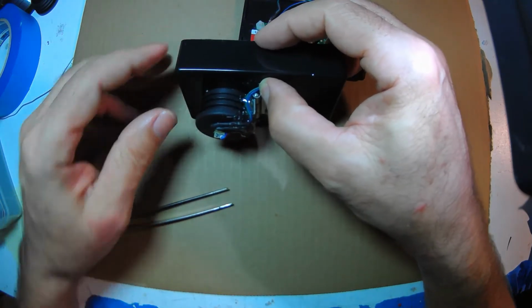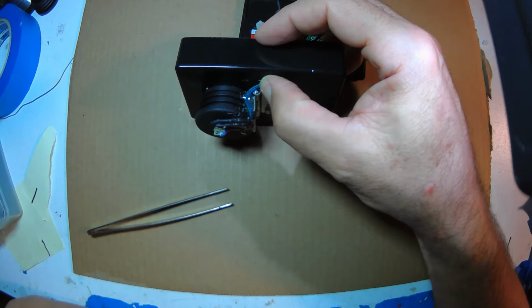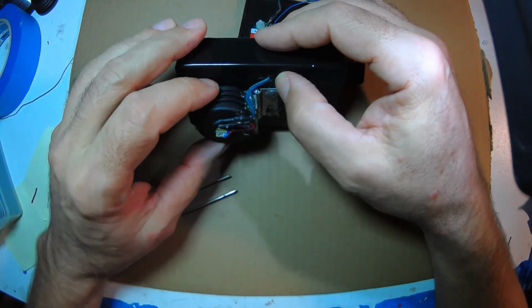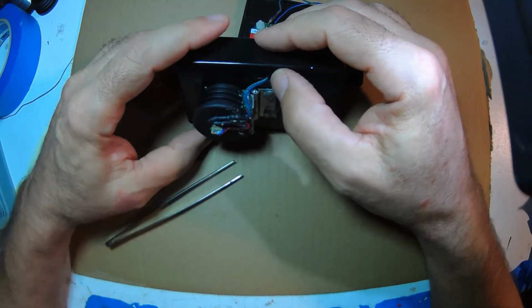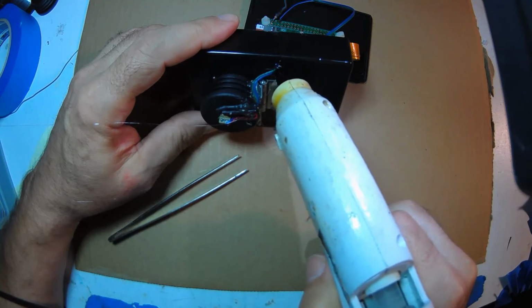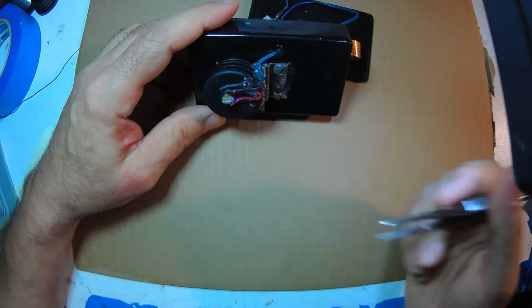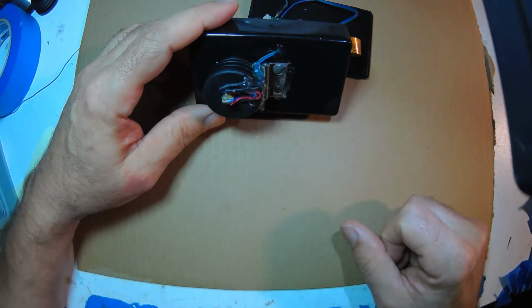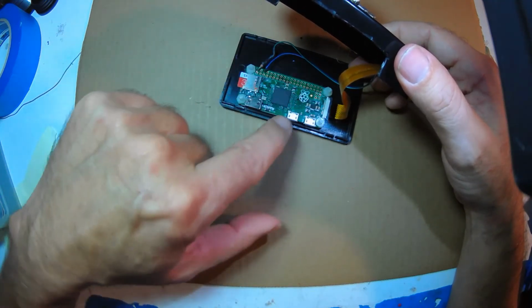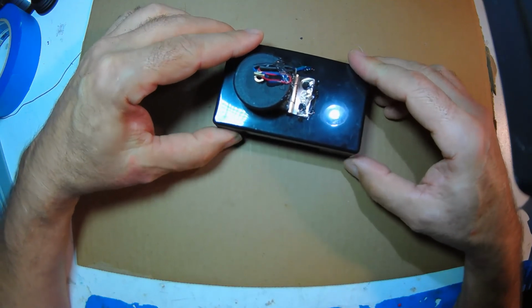It needs a little more time. I'll leave that free, and I'll just seal up that hole. Good. There we go. Now, if you really wanted to, you could bolt those in, but I like hot glue, it's fast. And so while that's hardening, the rest of it is basically just snap it together. All these are tight, and I got my SD card in there, and everything works, so I'm just going to seal it up. It just snaps together.